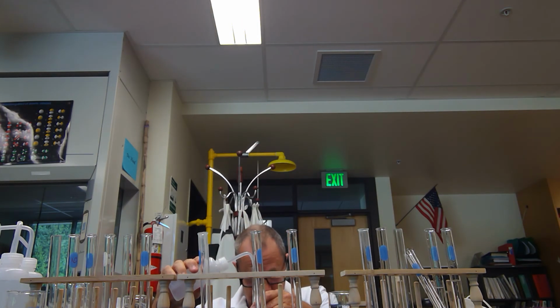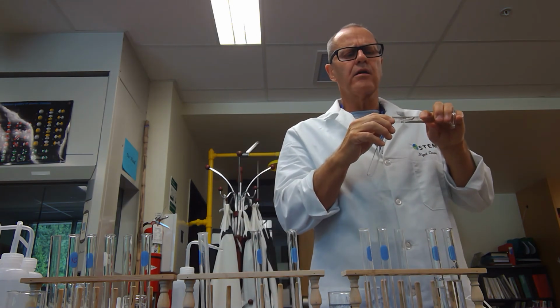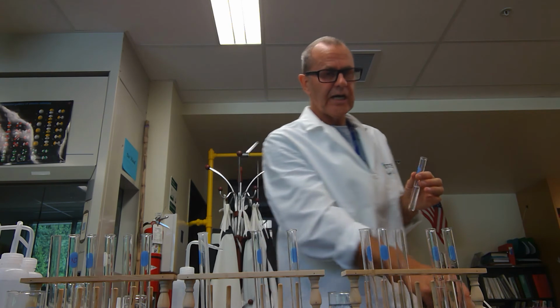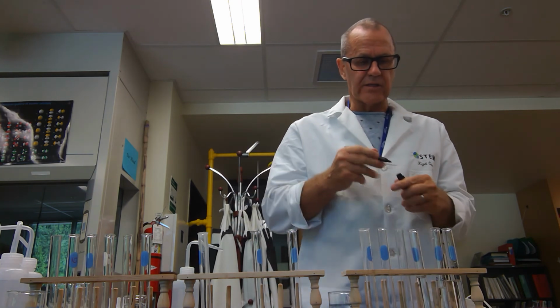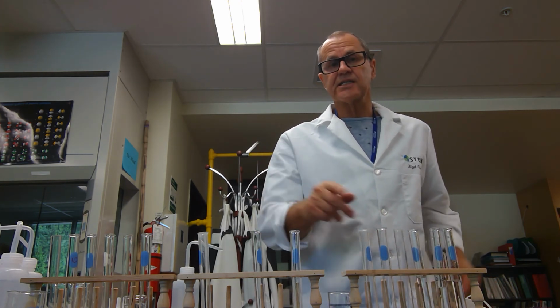And I'm going to keep doing that until I get a very, very dilute substance. And this one is now not 1/10 of the original concentration, but this is now 1/100th of the original concentration. And the next one is going to be 1/1000th, because I'm going to keep doing that for 4, 5, 6, 7 of these. And then I'm going to do the same thing with the NaOH.